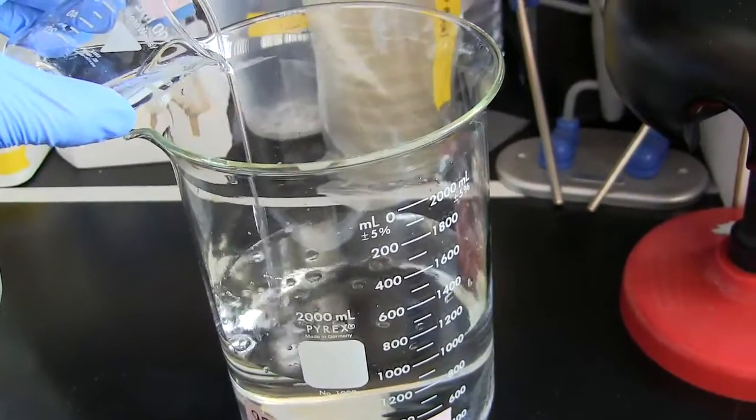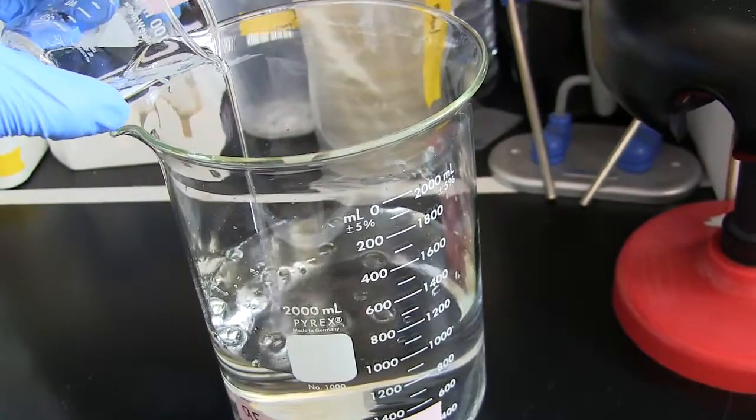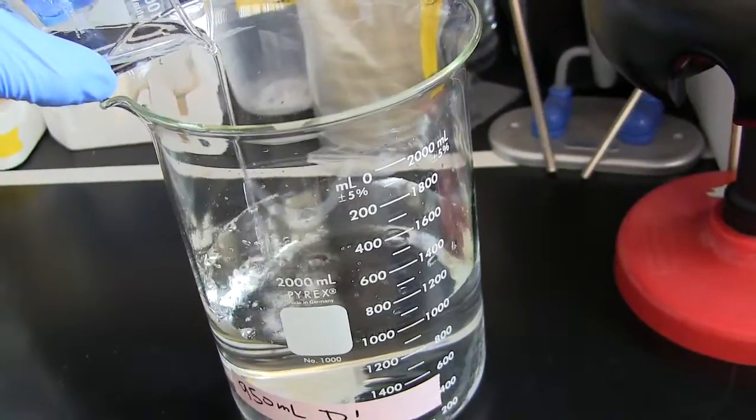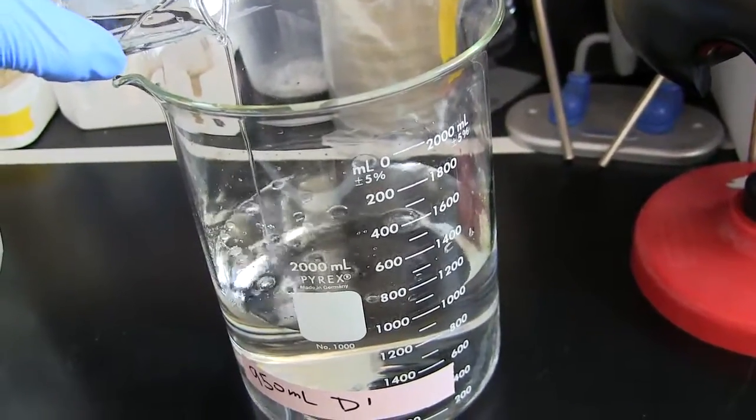Often you'll notice there's smoking when you pour the acid in. Make sure you always pour acid into water, not the other way around.